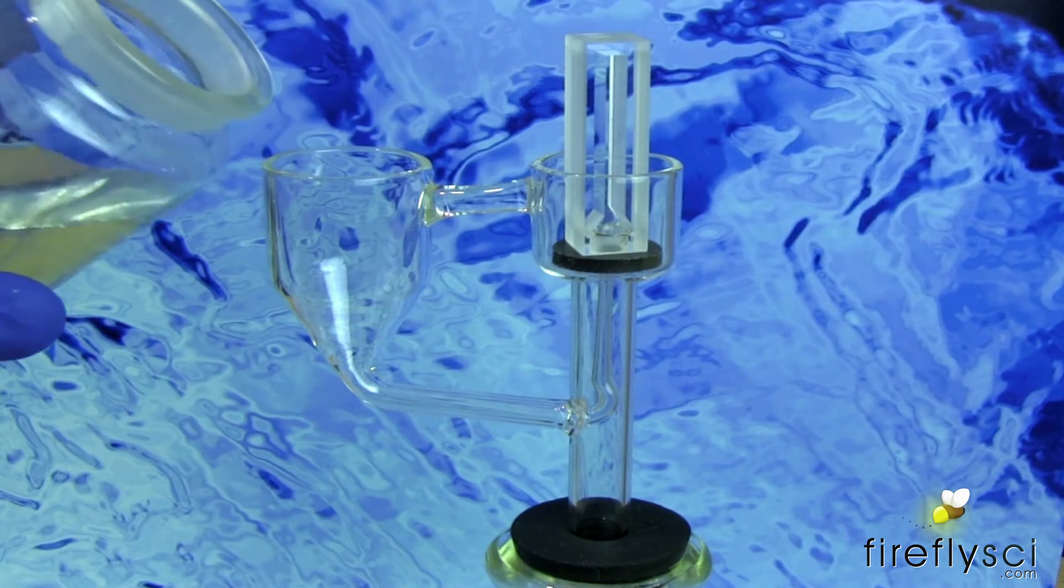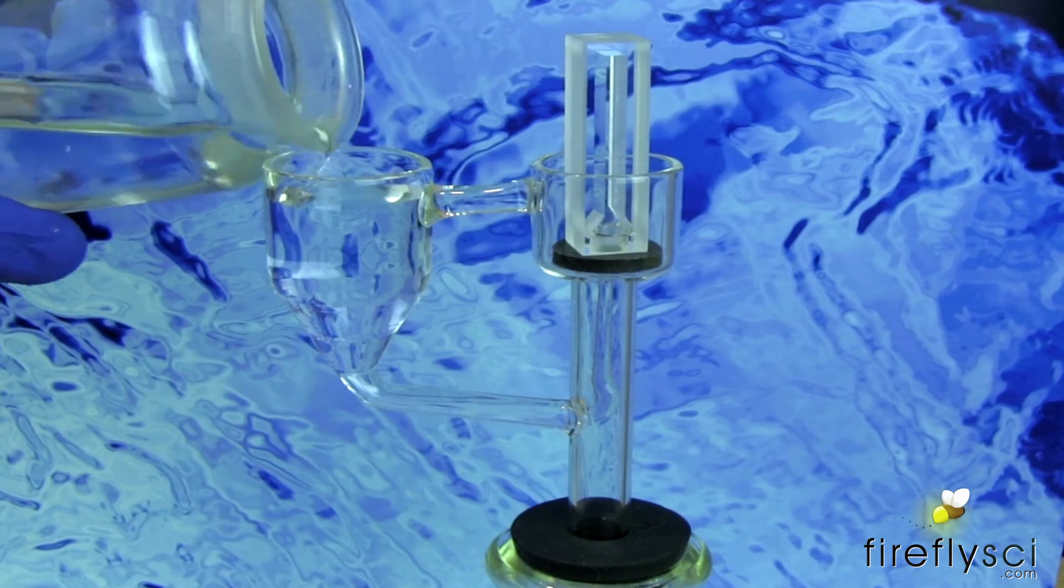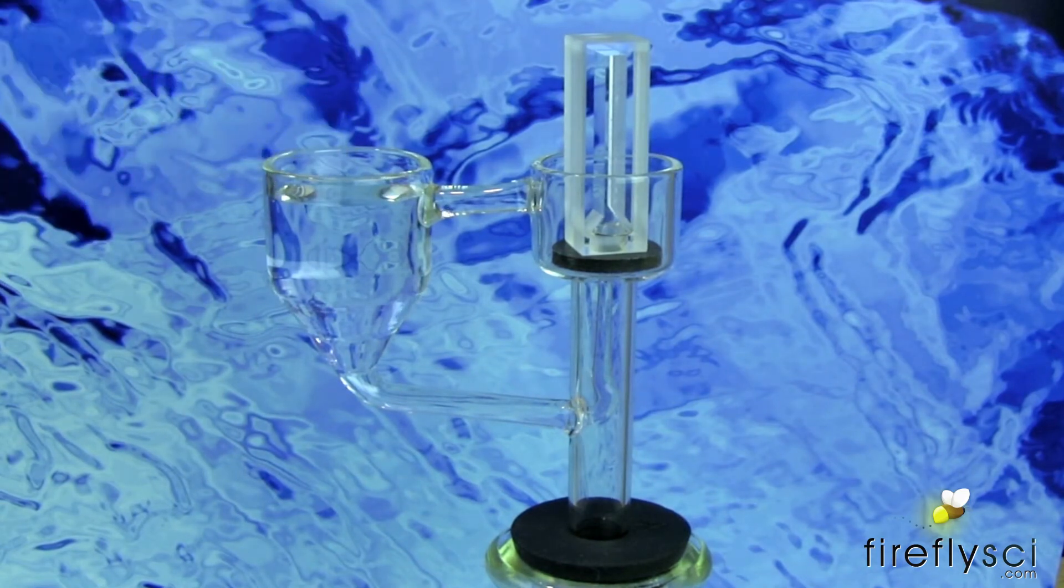Now I'm going to put my cleaning solution in. For this demonstration we're just using some distilled water. It pours right into the cup right there, and now I'm just going to put on the vacuum pump.